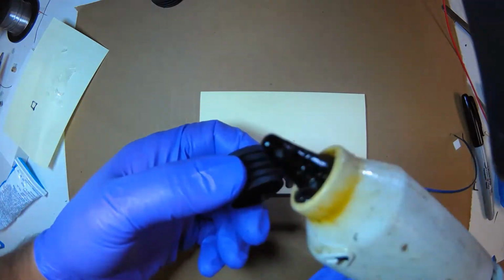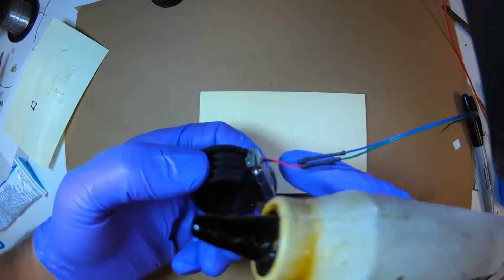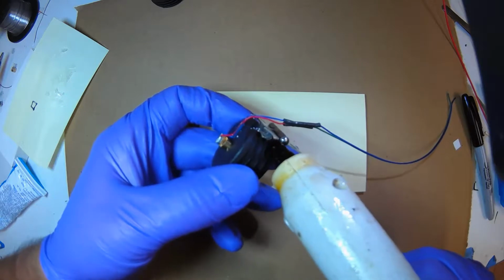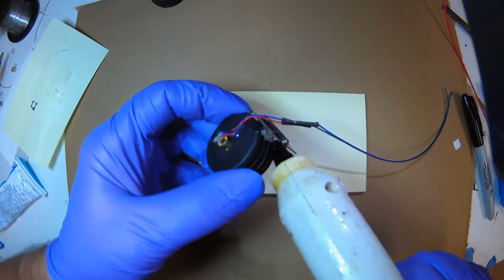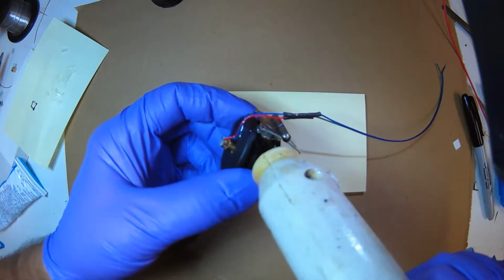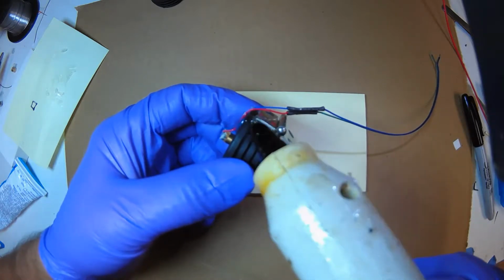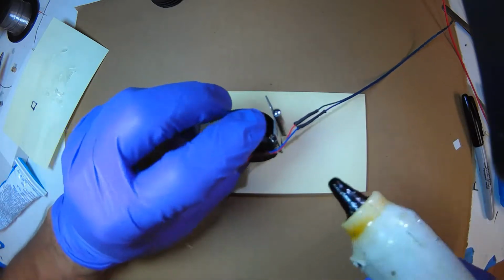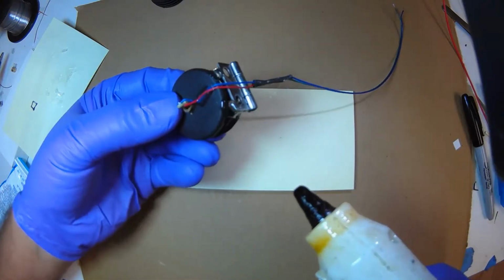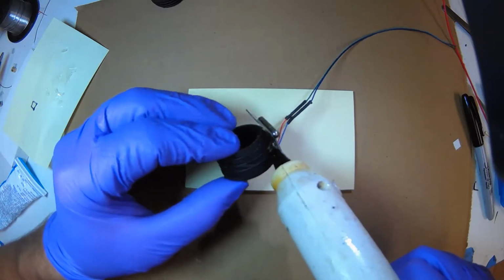I'm going to go in here. Try not to get hot glue on the moving part of the hinge, because then it'll freeze up. There are a lot of gaps in here, so I'm just going to squeeze some in. Actually, this is ribbed, so I can travel down the ribs. That's one side, and let's see if I can rotate it while it's still, yeah, it's not walking out. Okay, and fill in these ribs.